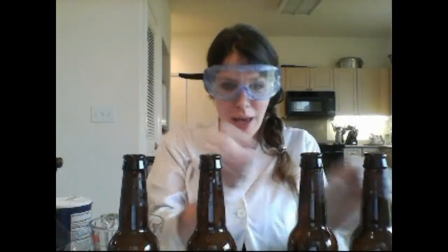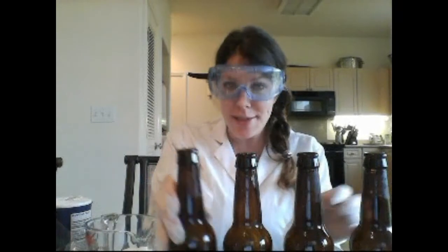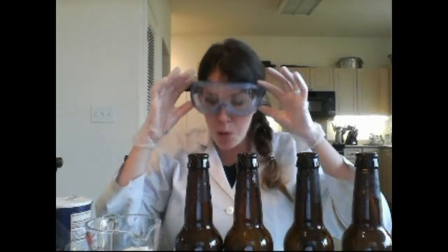I now have exactly 7.0 grams of yeast in each one of my four long-neck bottles. Now we're going to add the substances we're going to be testing: sugar, sugar substitute, salt — and then later we'll add plain water to all of these. The control will get nothing added besides the water. The others will get water plus their substance — sugar, sugar substitute, or salt. We're going to need exactly 4.0 grams of each substance into the respective bottles.